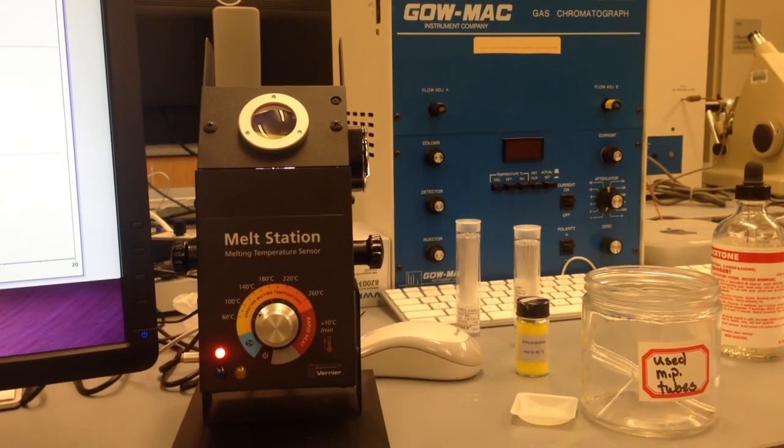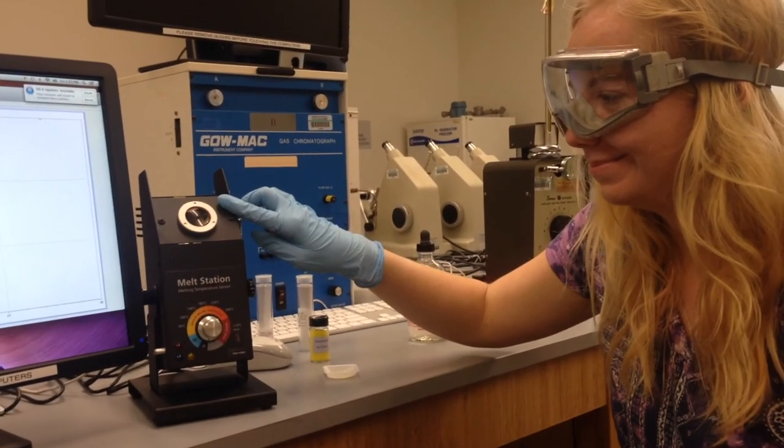Dispose of the used capillary tube in the proper container. Careful, the meltemp might still be hot.